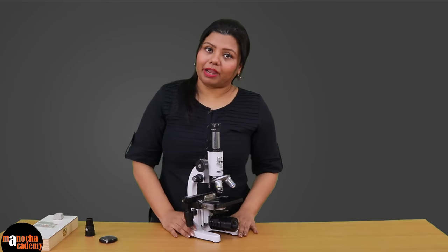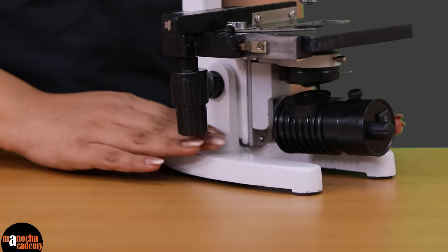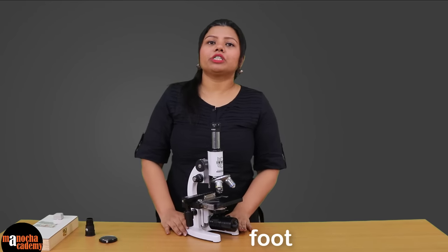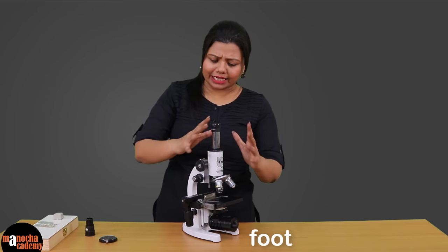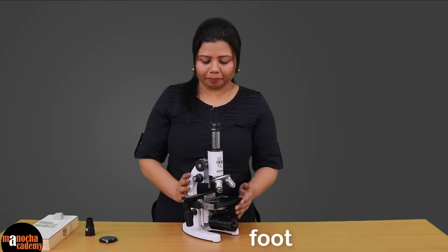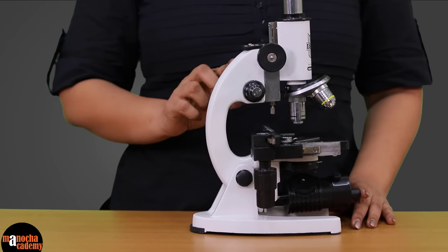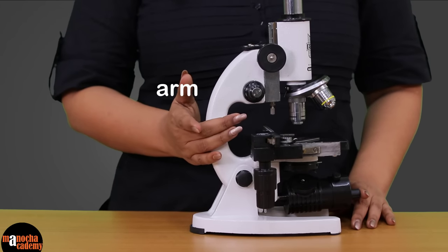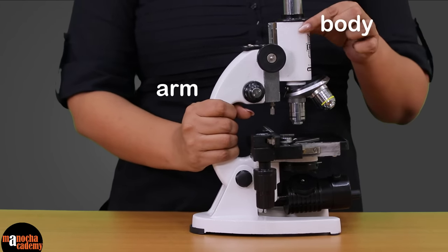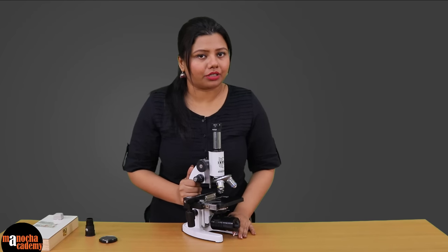The first part of the microscope that you see here is this region which is known as the foot. The foot is the base on which this entire microscope is standing. This arched part is known as the arm and the arm is holding this body to which two types of lenses are attached.